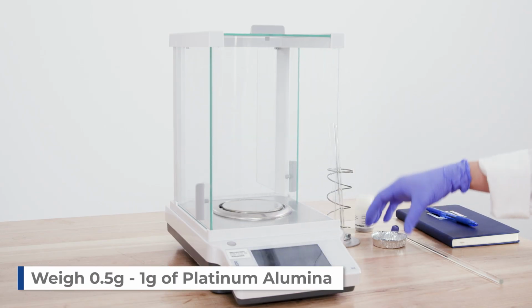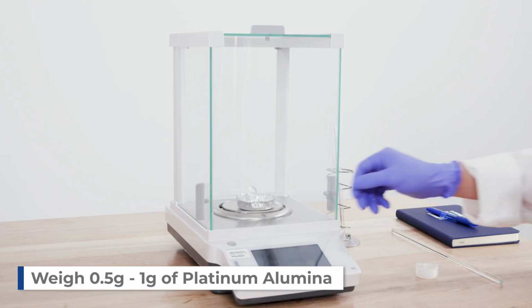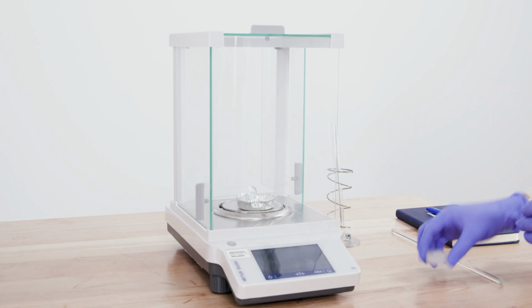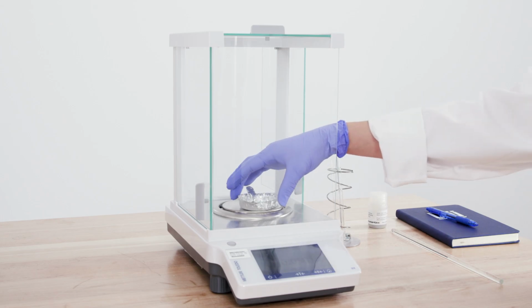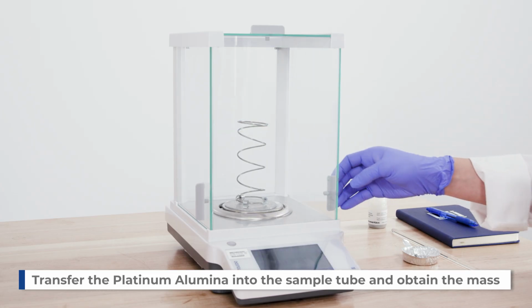Measure between 0.5 to 1 gram of platinum alumina and transfer it into the sample tube. Reweigh the mass of the sample tube with the sample.